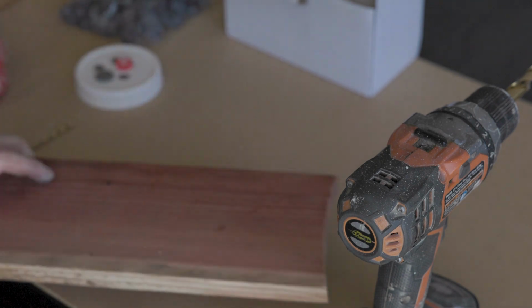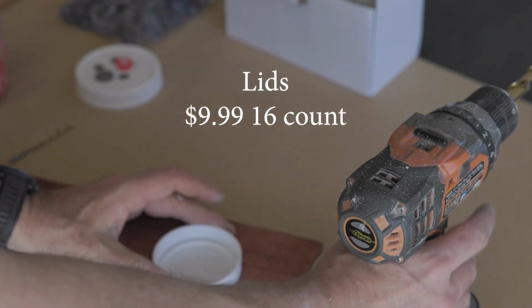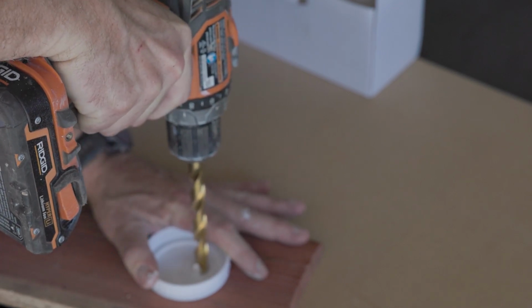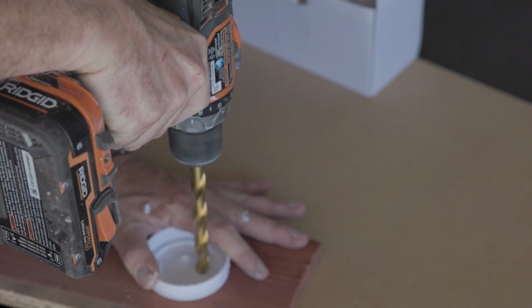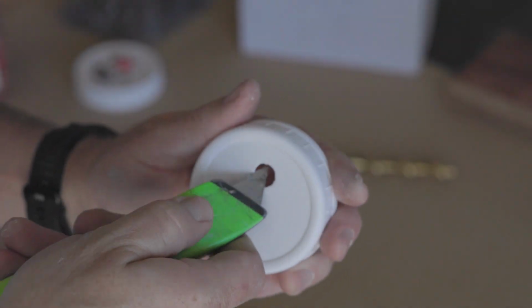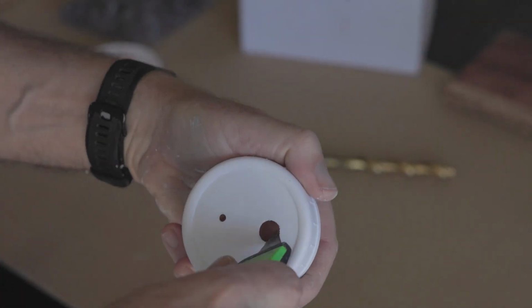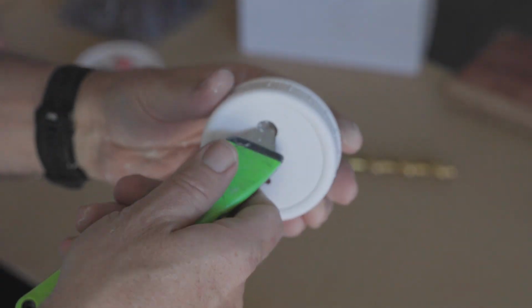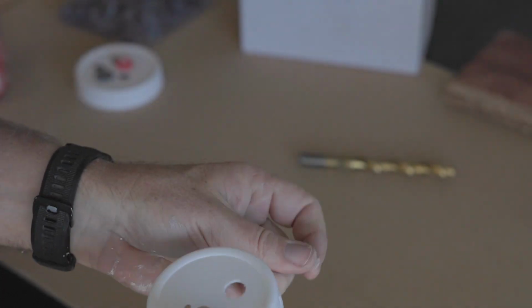Get another piece of scrap that I can actually drill into. It's not gonna screw things up. Again, make sure it's secure before it pops through. Like I'm saying, just get a little X-Acto knife, clean up that edge a little bit, and try to put through your self-healing injection port. It's nice and clean.